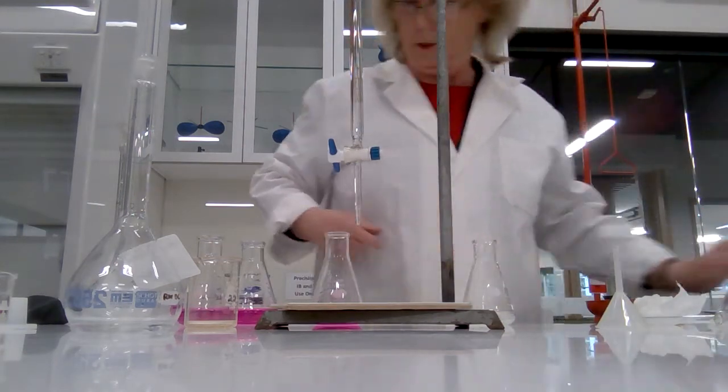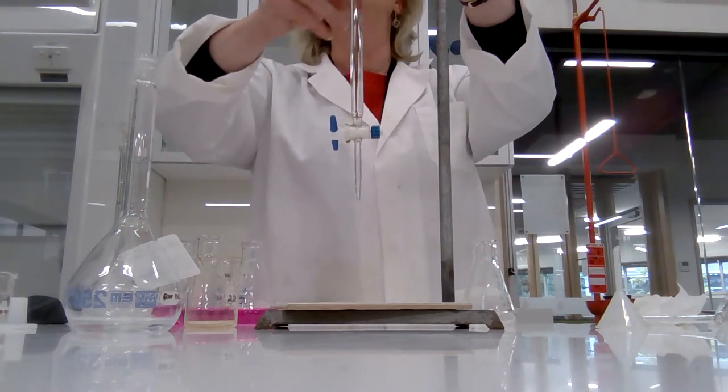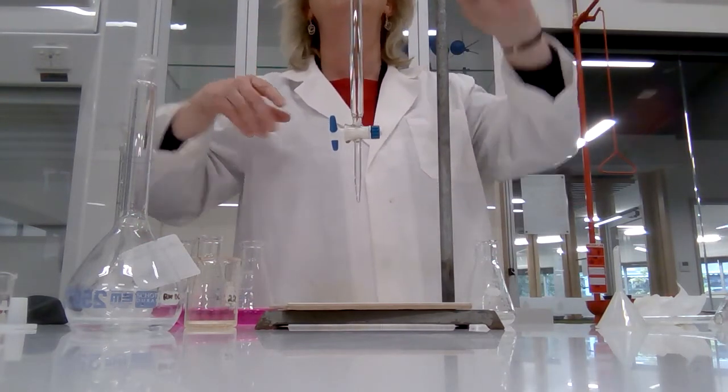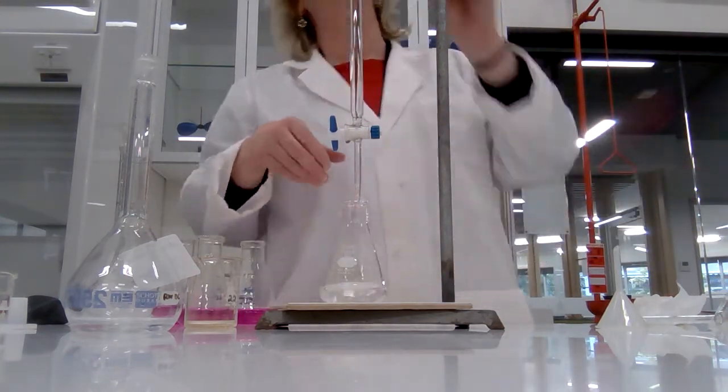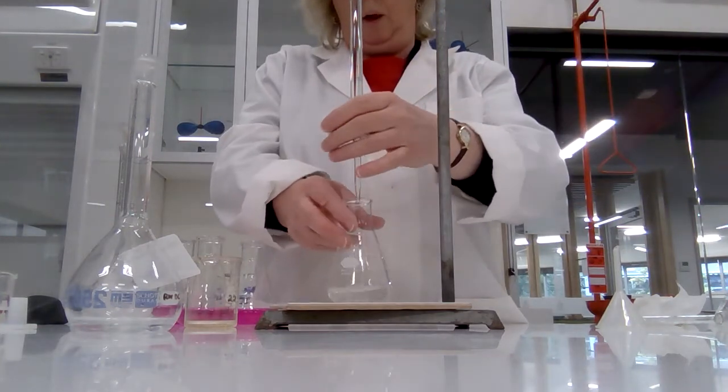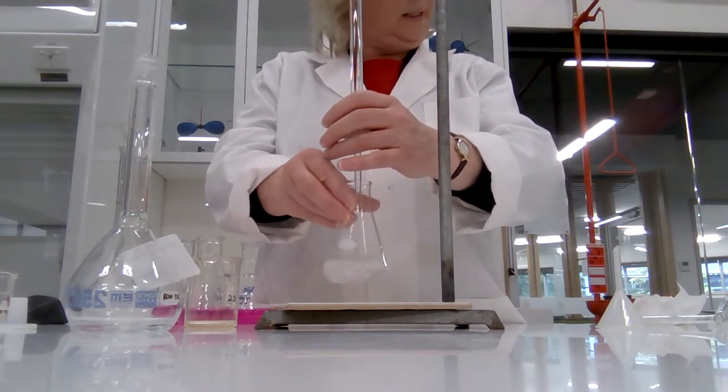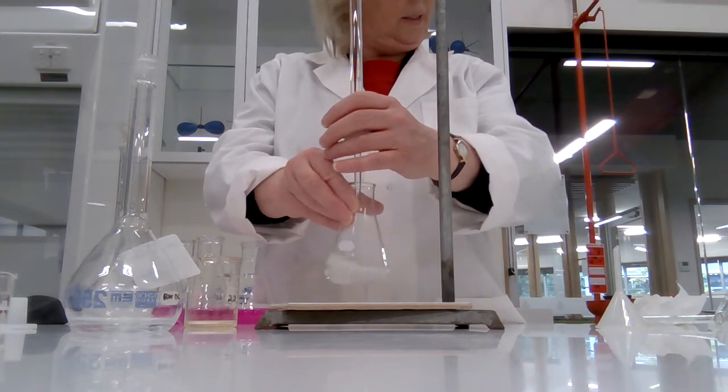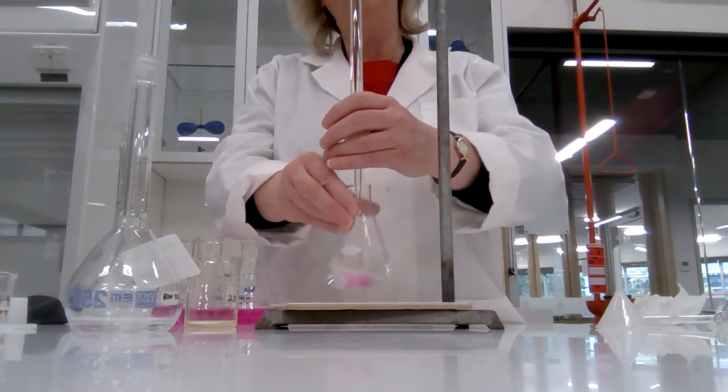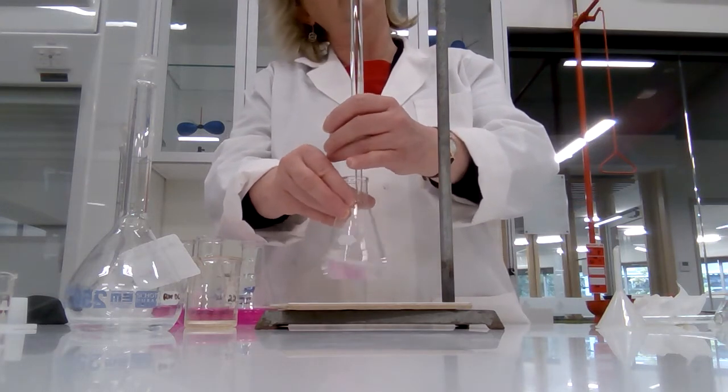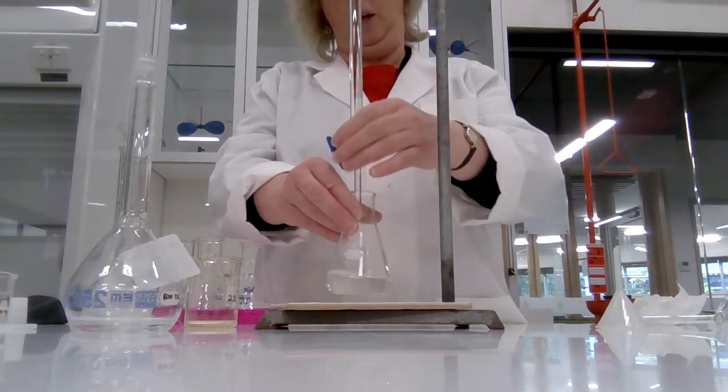Okay, if we can follow that up, we will get away with four titrations. So we're starting at 16.85, sorry, 14, no, 16.85, and away we go. So 16.85 plus 14.65 is 31.5. So I'm expecting to go down to 31.5, which of course is under burette clamp again. There we go.